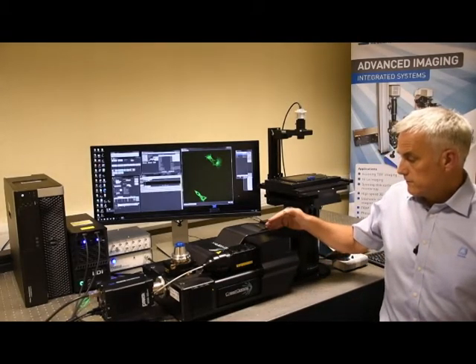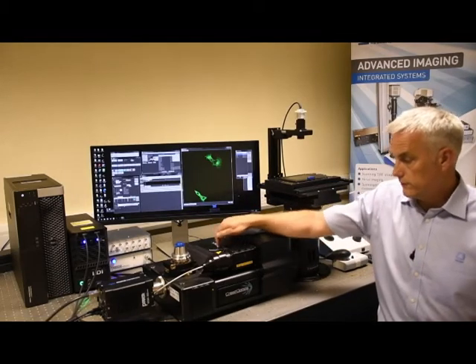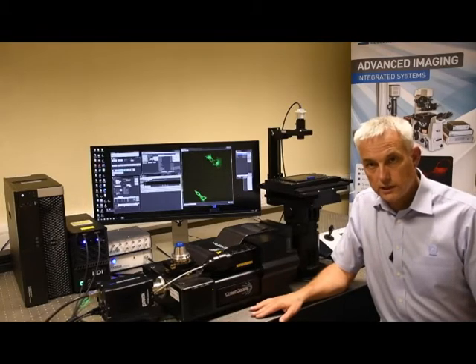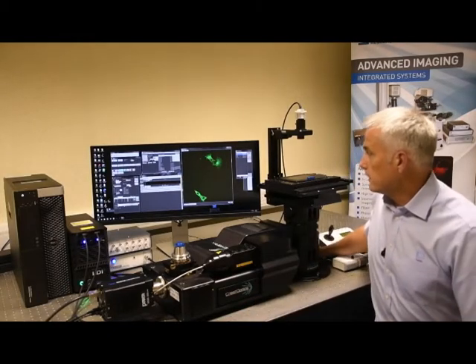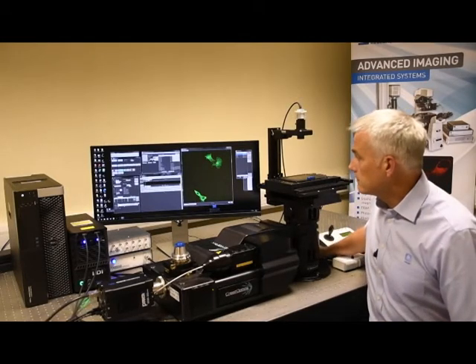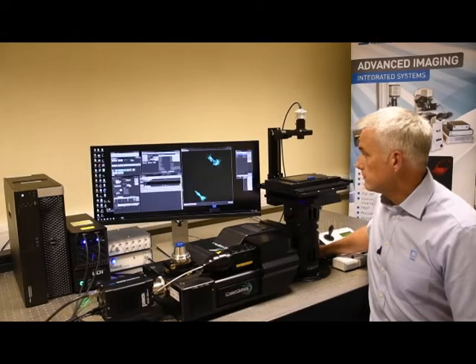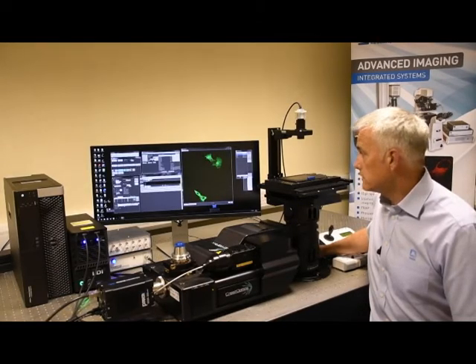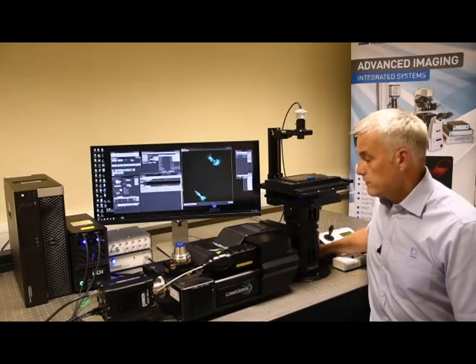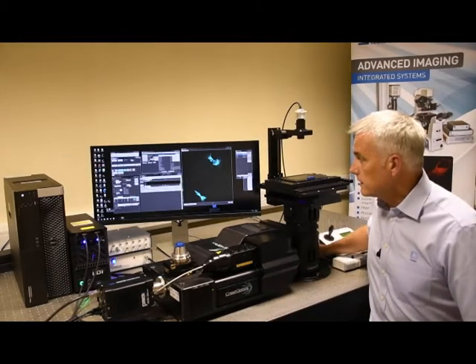The light path consists of an excitation filter wheel, dichroic filter wheel, and an emission filter wheel, which can change the component positions in tens of milliseconds to allow very fast channel switching between wavelengths. With a live sample on the microscope, we can switch from 405 to DAPI excitation, then to 470 with the LDI, 555, and 640. The emission filter changes are happening in a few tens of milliseconds.